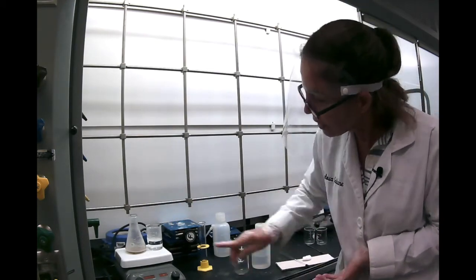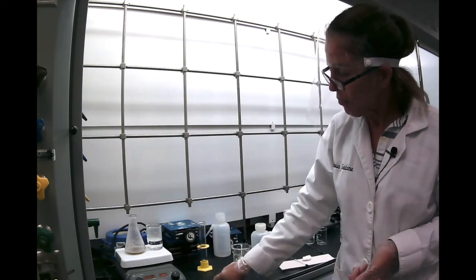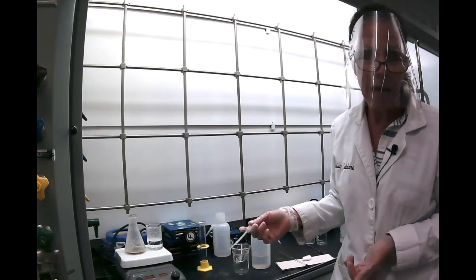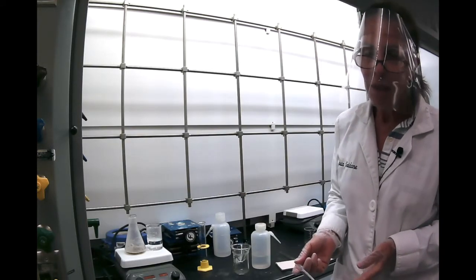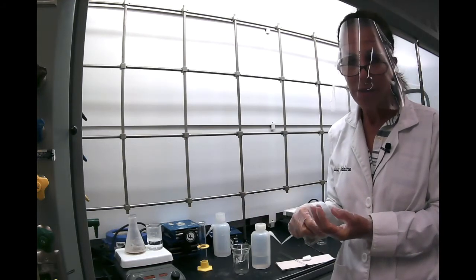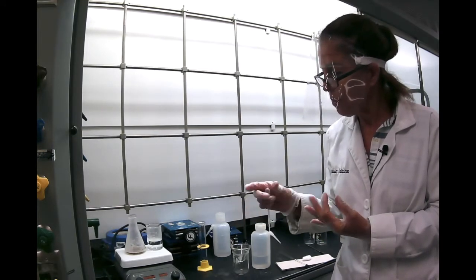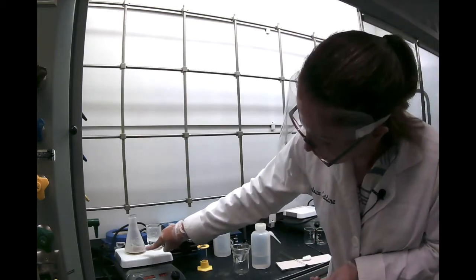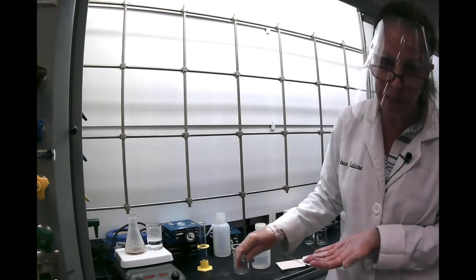So we're heating it and it looks like it's working its way. If it's not enough, I'm going to use the pipette and add 1 milliliter at a time until all the solid dissolves. Now what can happen there? You might have some solid impurities that are insoluble, and you might also have some impurities that are soluble and colored. So it looks like we're going to have probably both because our liquid is not completely clear.